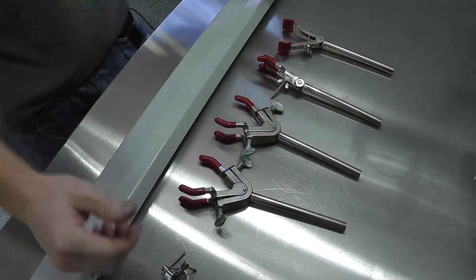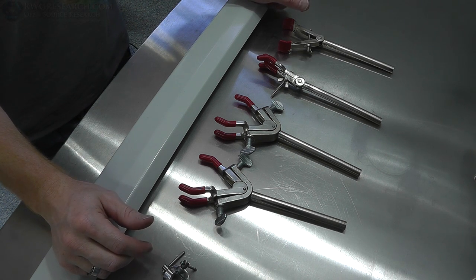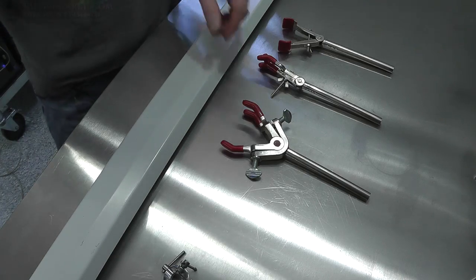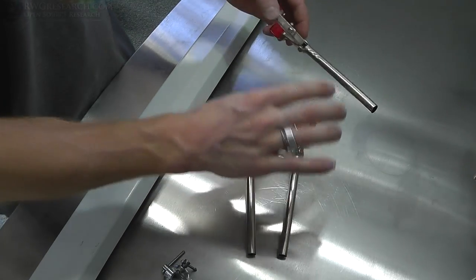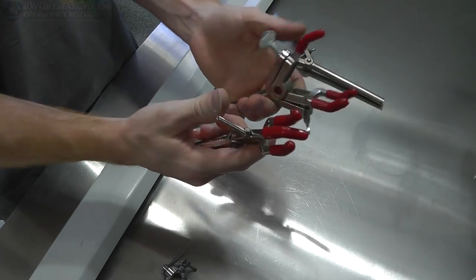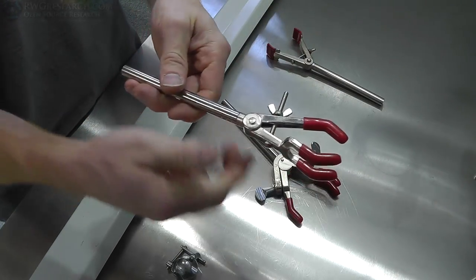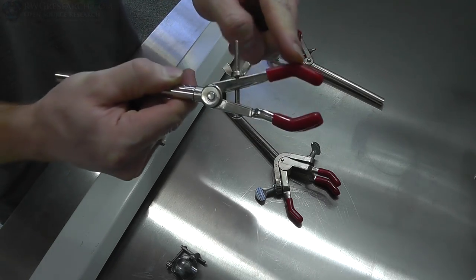All right, so briefly I want to talk about the clamping mechanisms that I have acquired. There's many, many different types and hooks and all sorts of things, but I have here some of the basic clamps. Actually, these are the same. So the clamping mechanisms themselves are all different kinds. These are three finger. These are just a single clamp. And the difference between these two, which are both three finger, is basically the fact that this is fixed. So this point is fixed and you always set your part up against here and then it always clamps this way because that's how this one works.